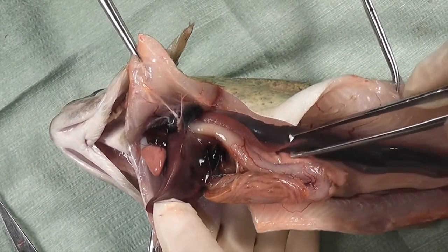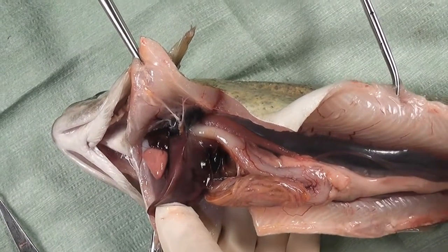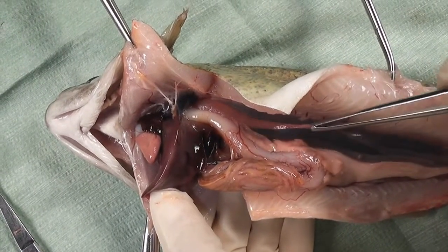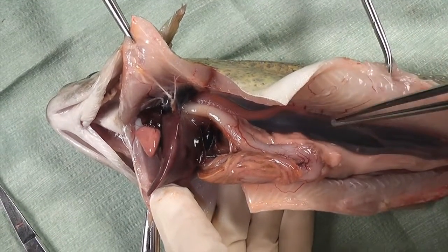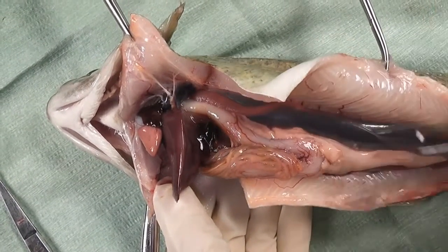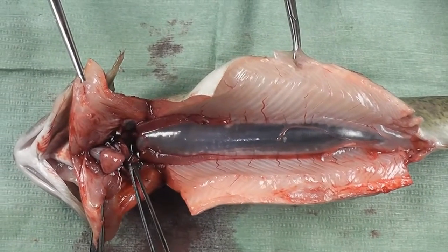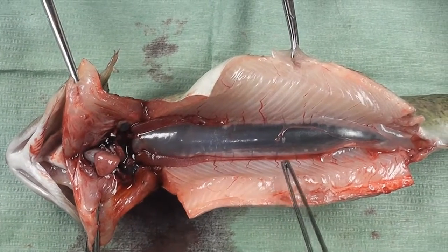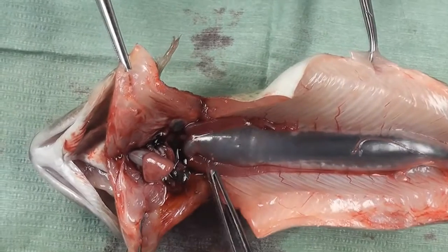We can observe the kidneys. Now we can show the presence of the gonad, not differentiated. Now we can describe in detail the swim bladder after removing the digestive tract, and adhering to this we can observe the gonad not differentiated.